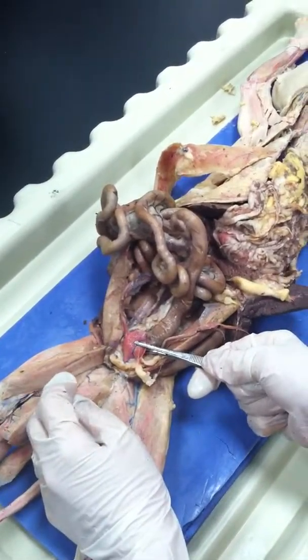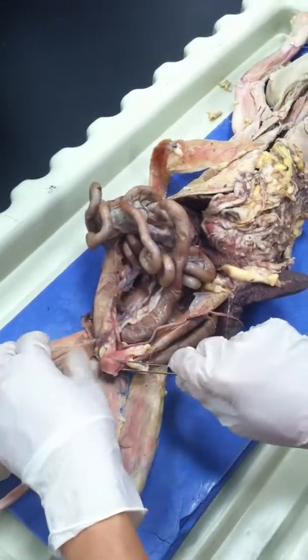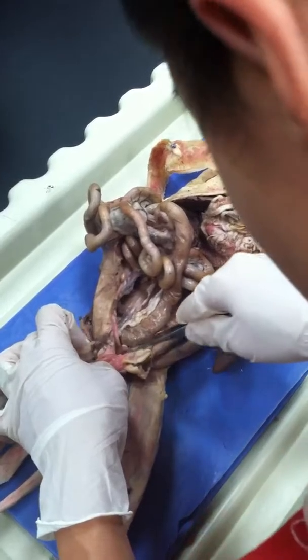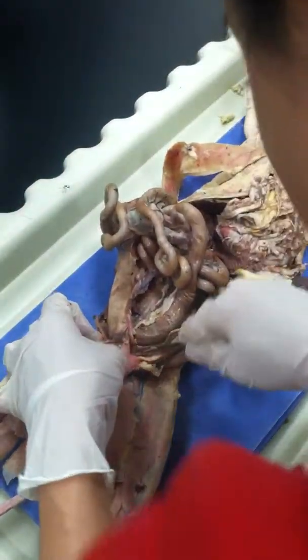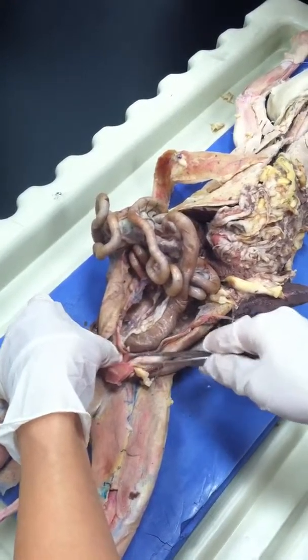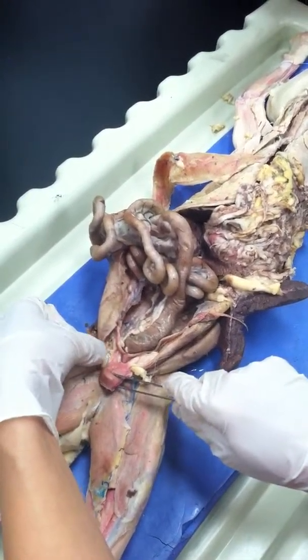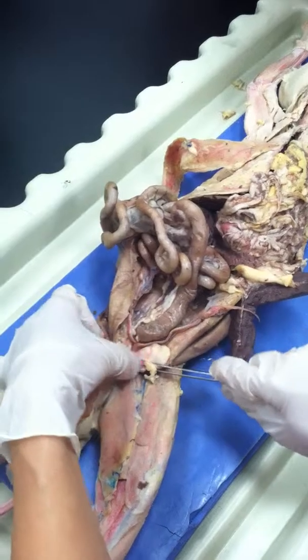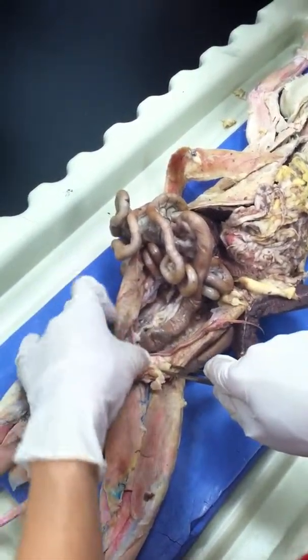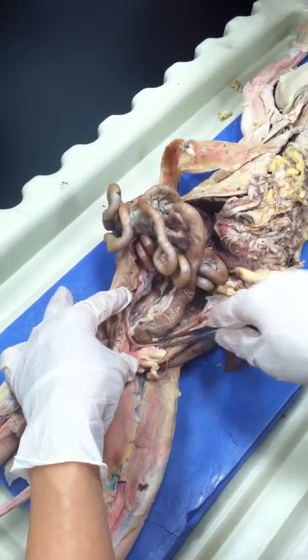Unless, because you said this is a bladder, right? Where are the ureters? Well, here, but it's not. Do they enter the bladder? No. Have you seen them? Right there. I mean, under here, you see, unless the bladder is this small, and then this is the uterus? Uterus. Wait, poke that one. You see, this is the uterus.